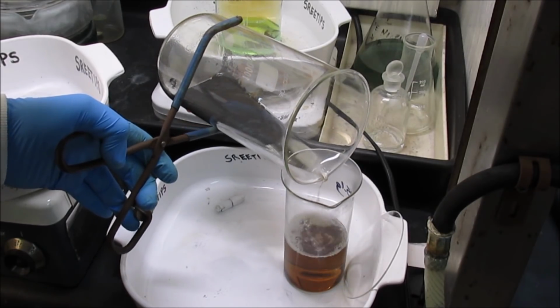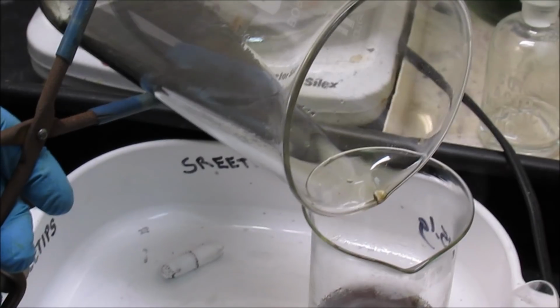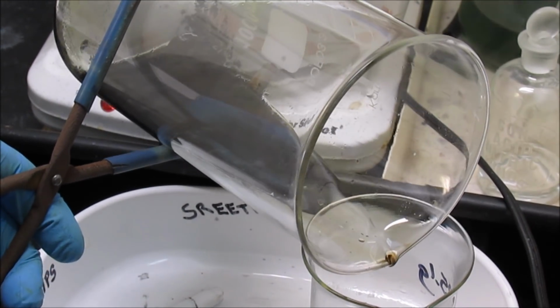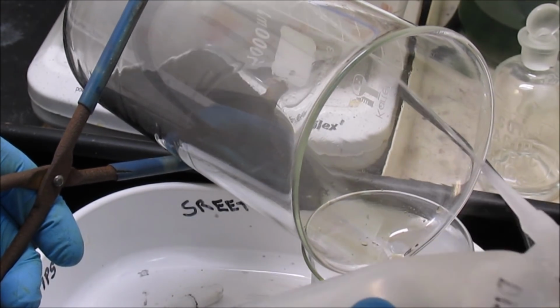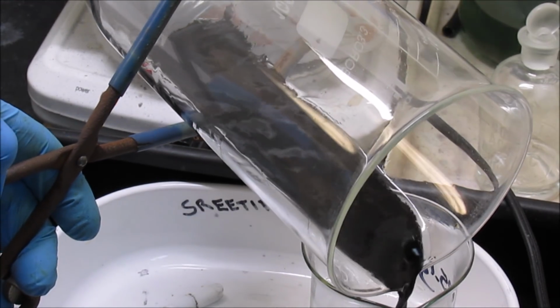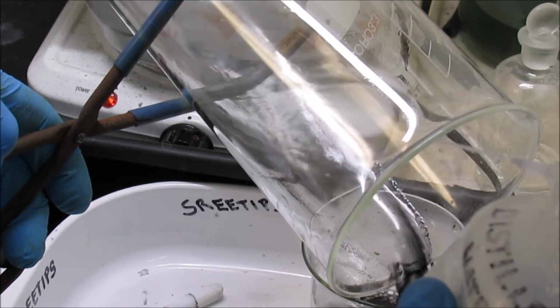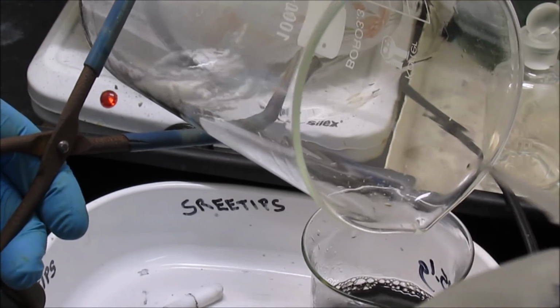Oh yeah, that black powder is looking real good now. Just kind of wanted to get a close-up of how much different that black powder looks now. It's looking fluffy and clean. I'm just going to let this all settle out. I probably could have just decanted the solution right there.